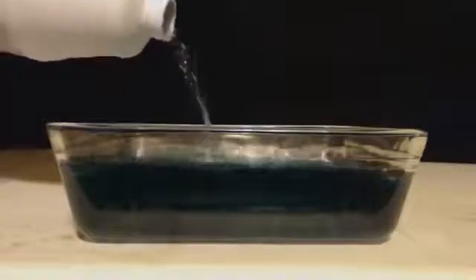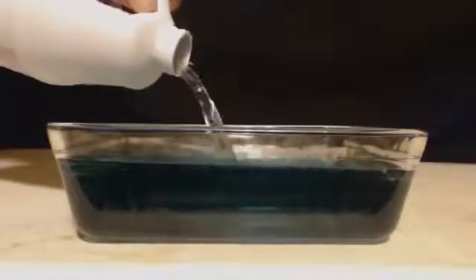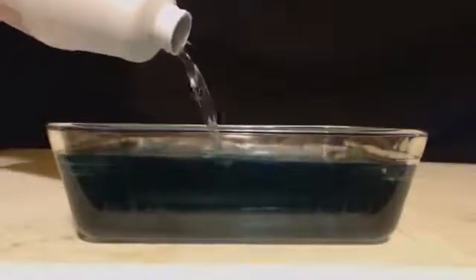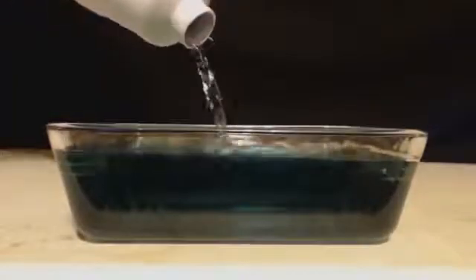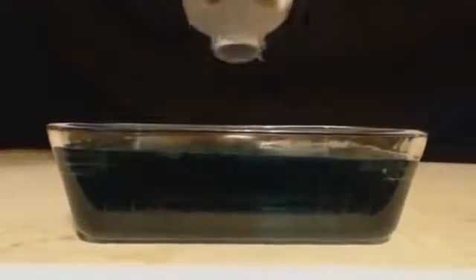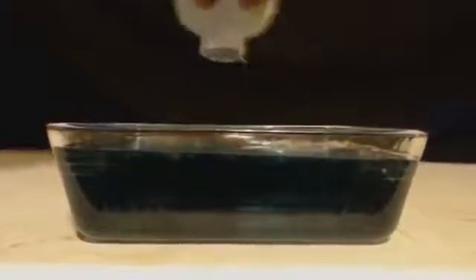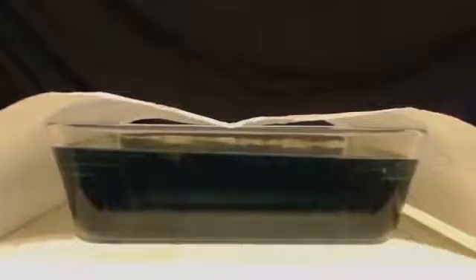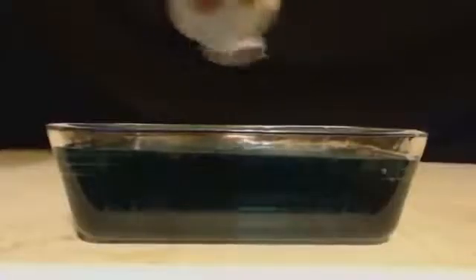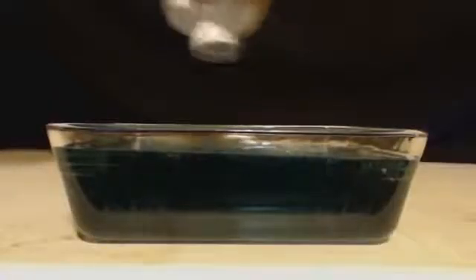Now you don't want to superheat this stuff because it does ruin your glass if you superheat it all the time. Basically, I have forced water heat - a big radiator that gets real hot. I just put the thing right on top of the radiator, let it sit, and then I get some paper towel and put it over top.